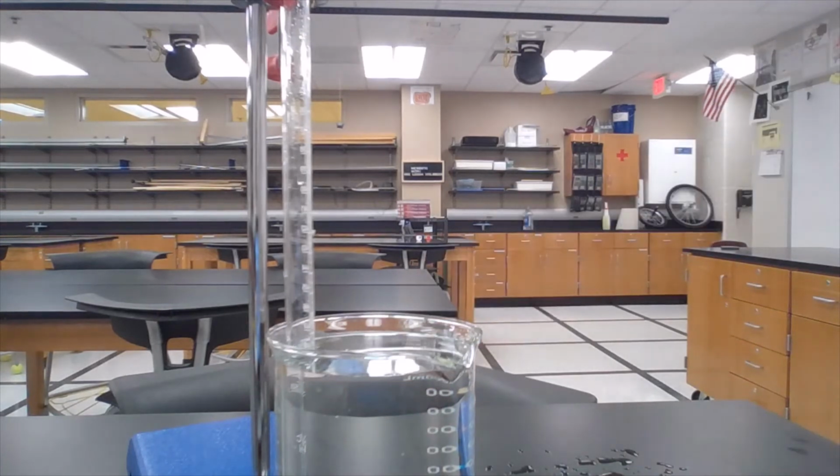So I'm going to look there, and you couldn't quite see it on the camera, but the volume measurement is 48.40 milliliters. So go ahead and record that under the volume of butane gas. So 48.4 milliliters.